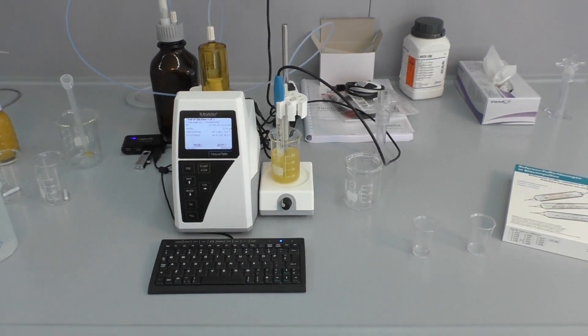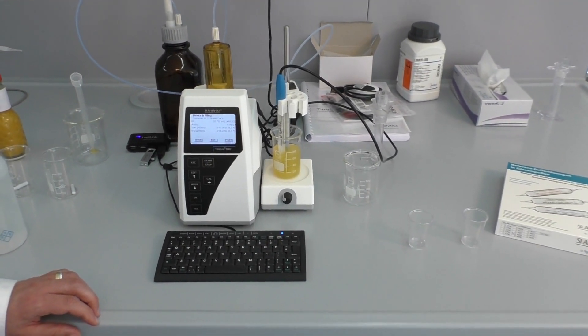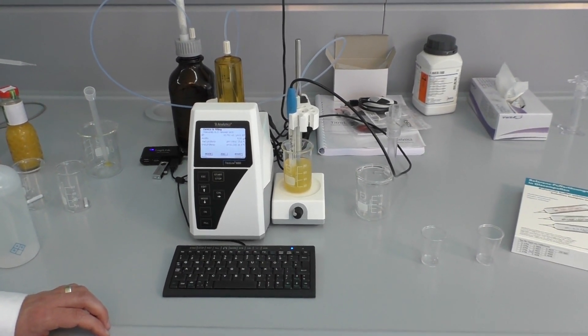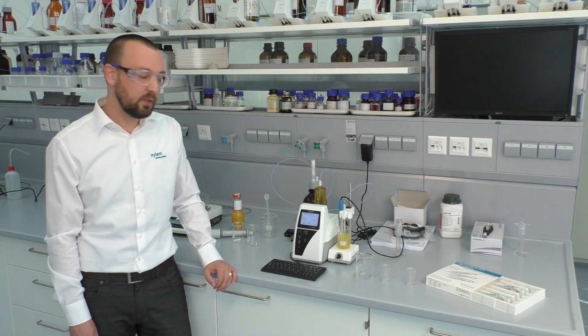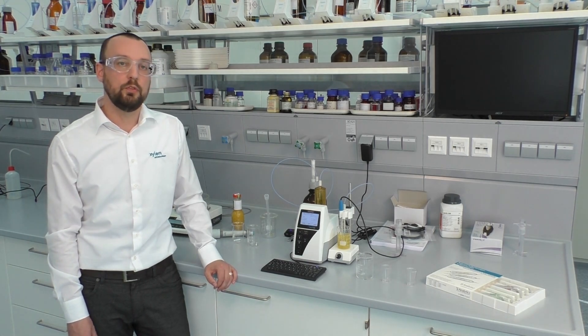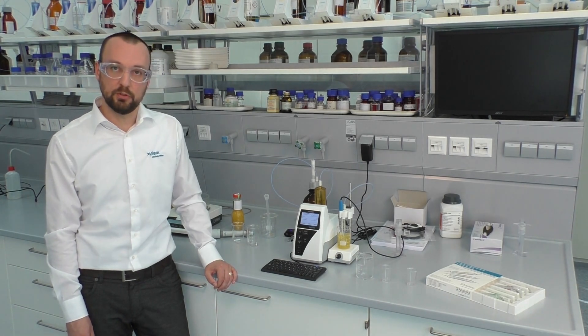When the end point is reached, the titrator automatically calculates the result of the titration. The result is shown in the display and the PDF is printed on the USB stick. When the titration has finished, the electrode rod needs to be rinsed and then the titrator is ready for the next titration. As you see, the default methods are already usable for many applications and it's quite easy to perform such a titration.